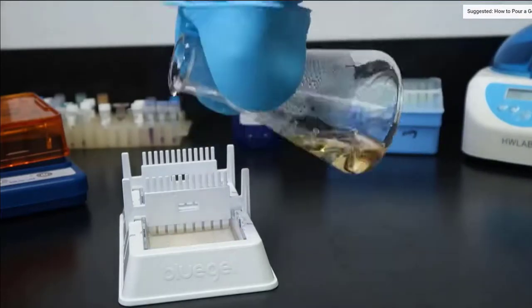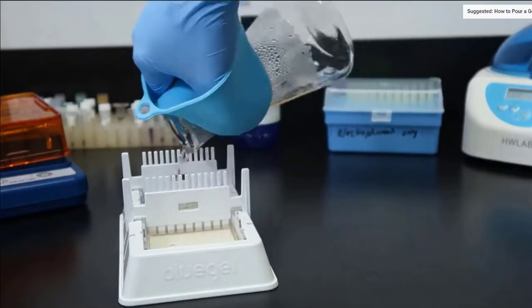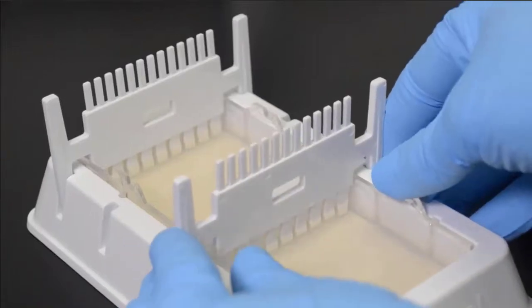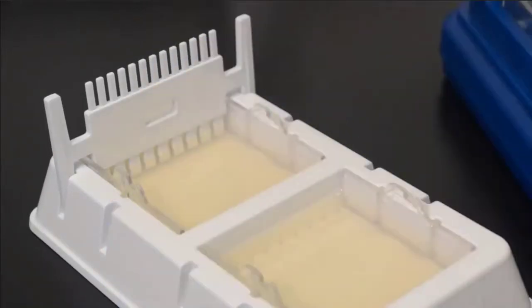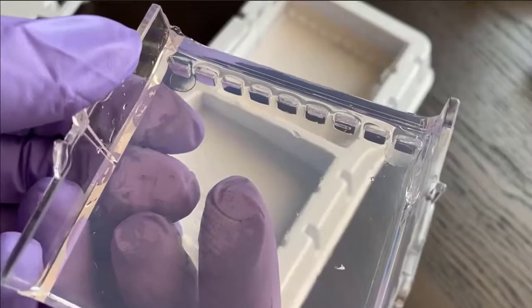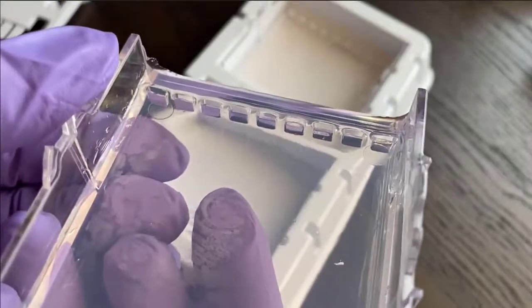In order to see our sample in the gel, we first need somewhere to add the DNA. To accomplish this, we place a comb at one end of the gel. Here, we have poured two gels. When the gel cools and hardens, we pull this comb out of the gel and small wells are left behind. The wells are like little pockets in the gel, and they are how we put our DNA into the gel at the start of an electrophoresis run.